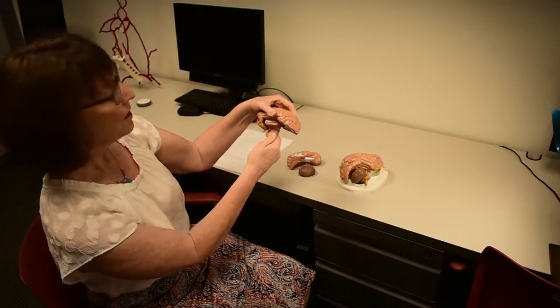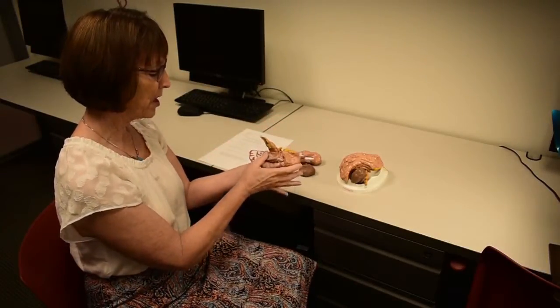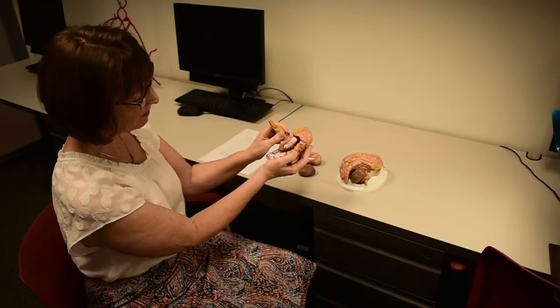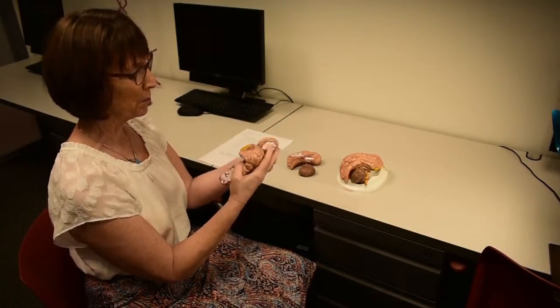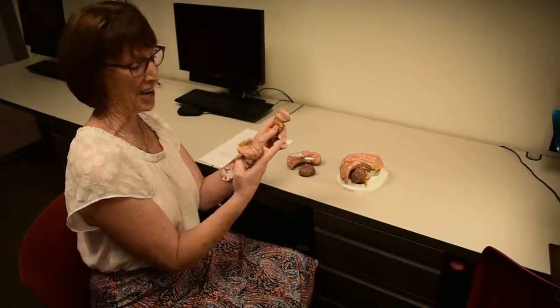and you can see it doesn't completely fill in the space. So I've asked a question at the bottom there, which says, visualizing from the bottom, locate the lateral ventricle, and then what part of this cavity does this diencephalon occupy? I'll show you in a moment, this is half of the diencephalon, so obviously there's two to make it di.